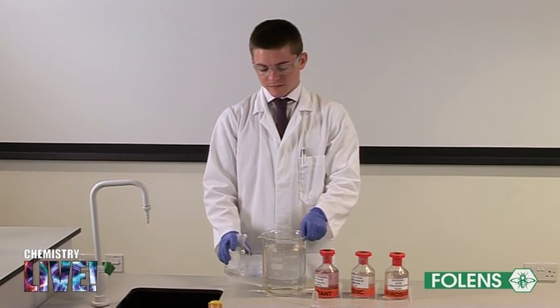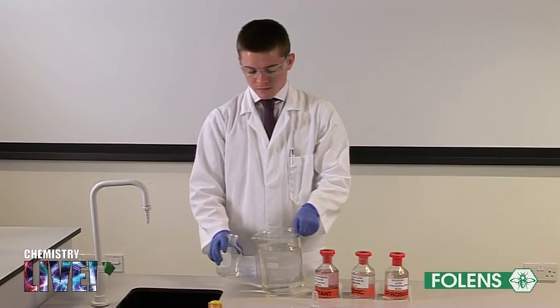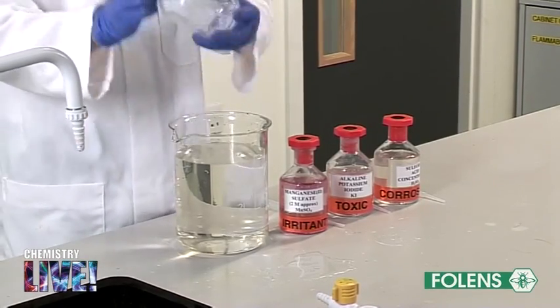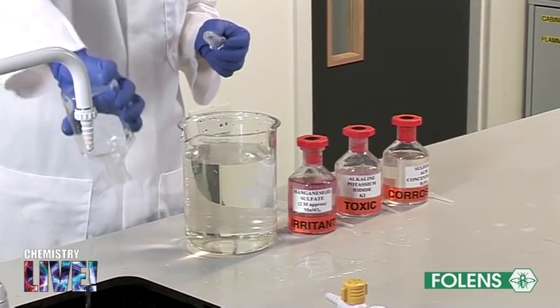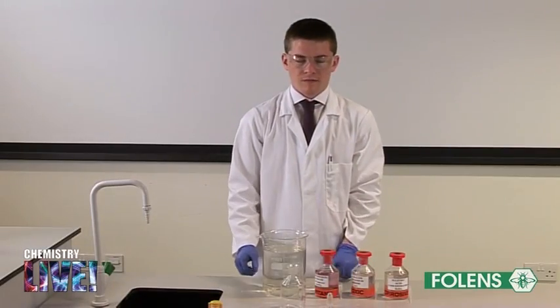This experiment involves collecting a sample of water in a bottle. Pour some of the water being analyzed into the bottle, shake the bottle a few times and empty out the water. Rinsing out the bottle with water removes any impurities, wets the inside of the bottle and helps avoid trapped air bubbles.